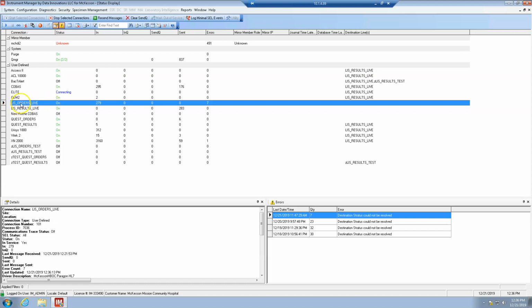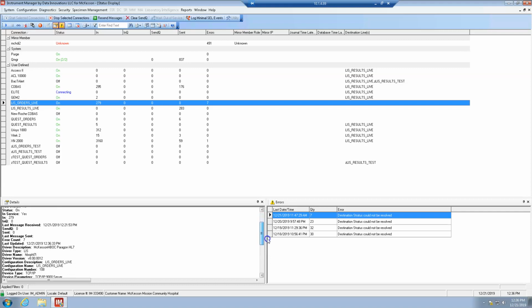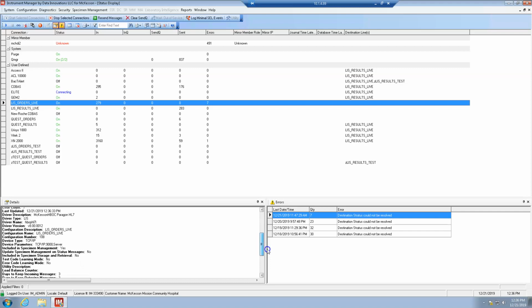So obviously, LIS orders live. This is where the orders go into. And if we look down here, where is it? It keeps flashing up. Come on, bam. So IP 9000. So this is listening for the orders on port 9000. So we're looking at the right interface.